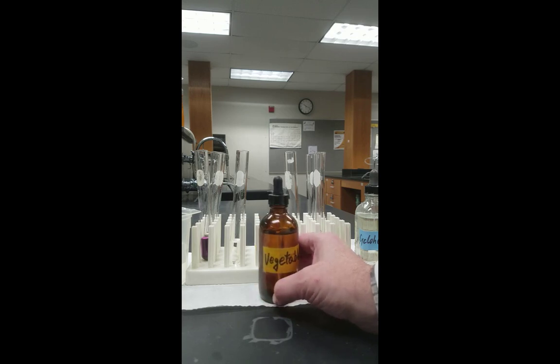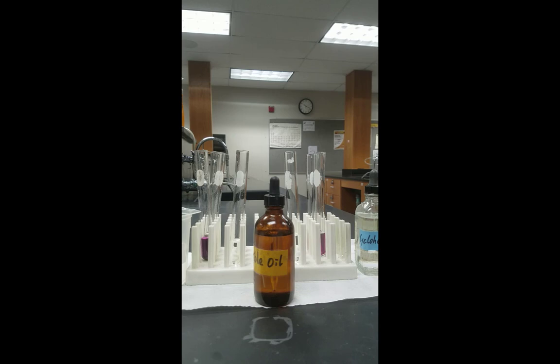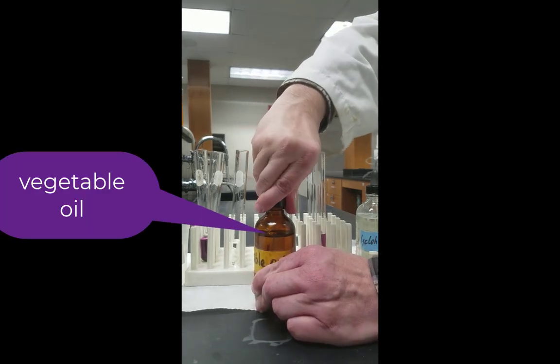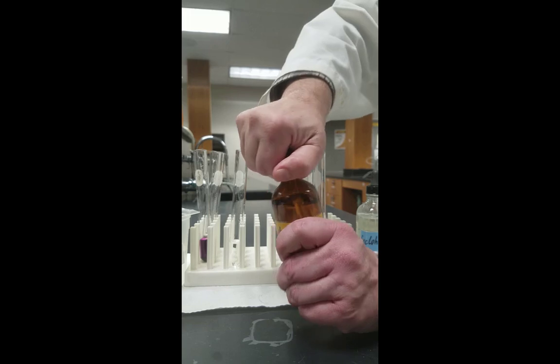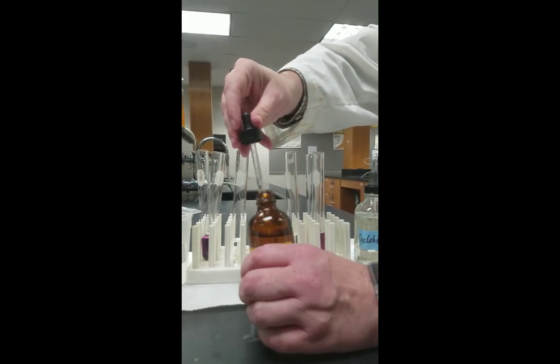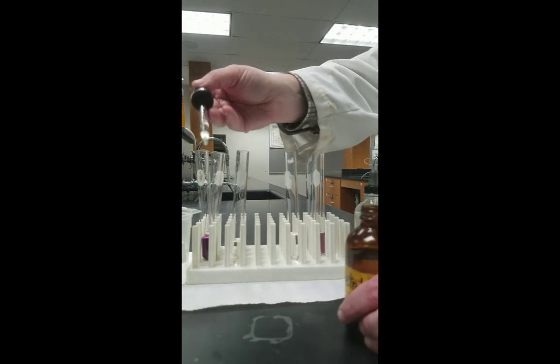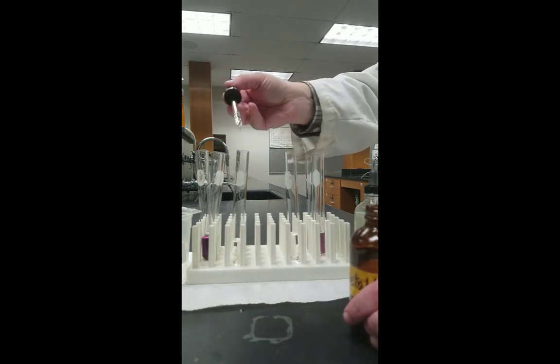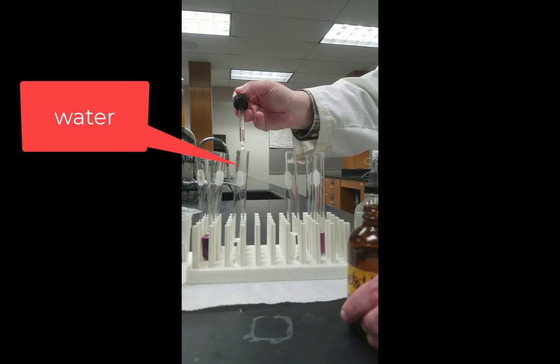Finally, we have vegetable oil. You should be able to predict the results of this one quite well yourself, considering you all know that oil and water are supposedly not going to mix. But with this being a liquid, we have to test it a little bit differently. We're not looking for what we call solubility here, so much as what we call miscibility. Will the liquids mix?